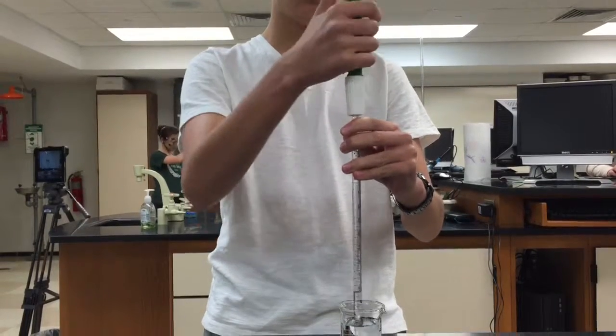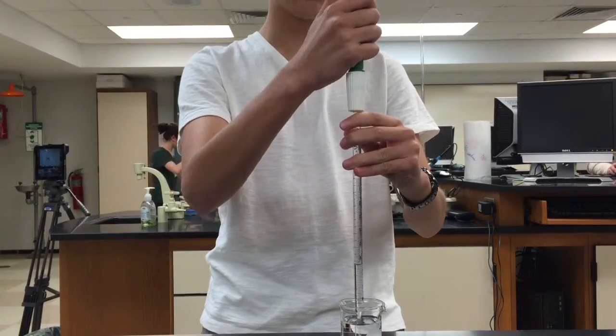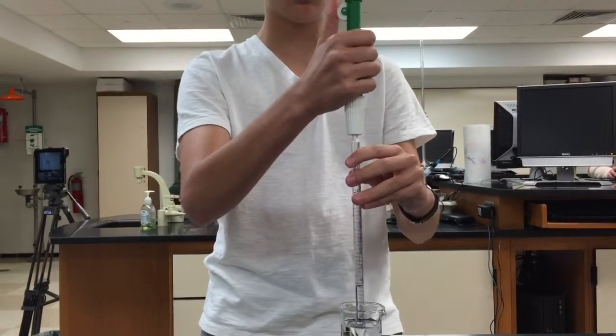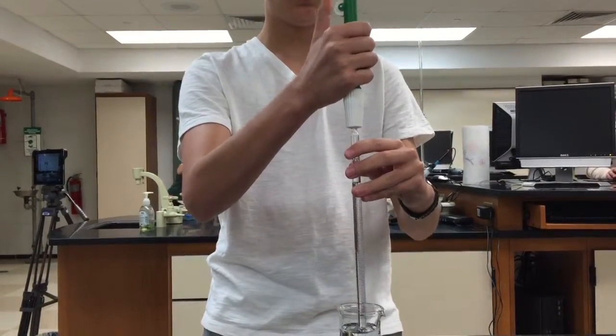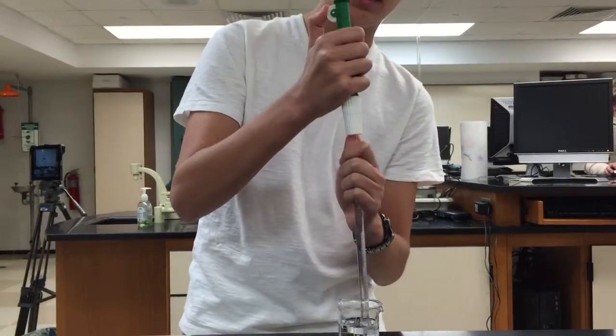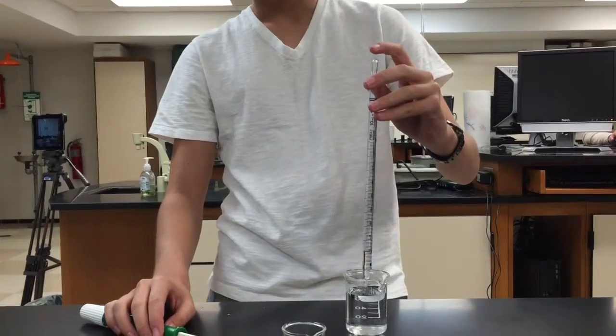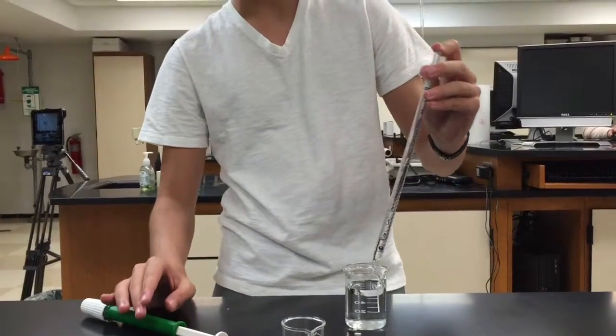I'm going to bring more up into it just so it's easier for me to work with. Okay, so I got it most of the way full. I need to detach this. I still have a bunch of my liquid in here, but I only need a very small amount.